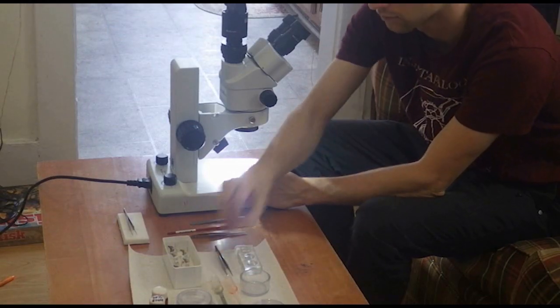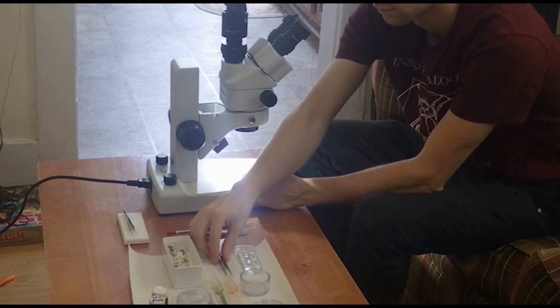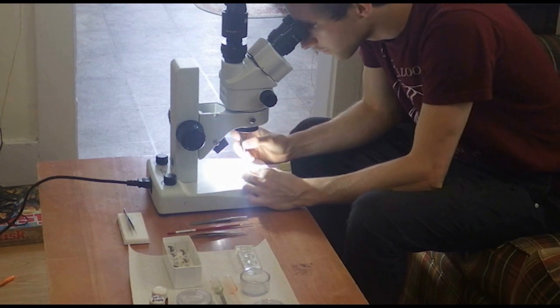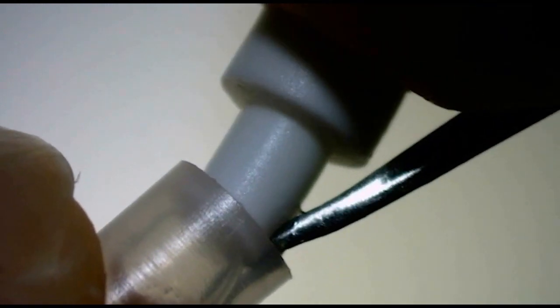I then add a rubber cap. There's often a trapped air bubble, so you need to let it escape as you push down the cap to prevent the cap from popping right back off.